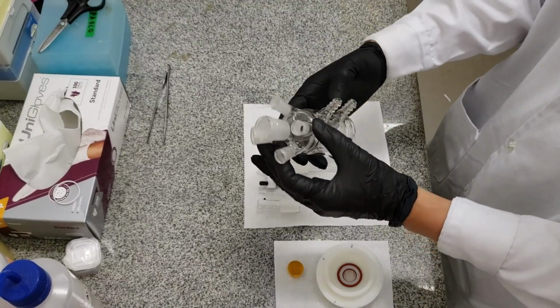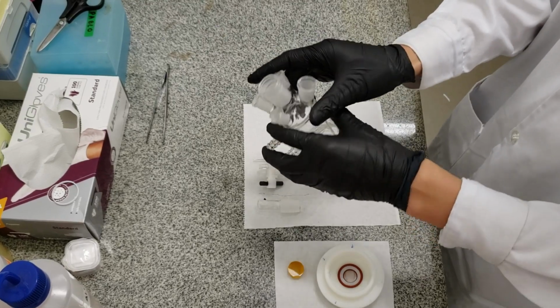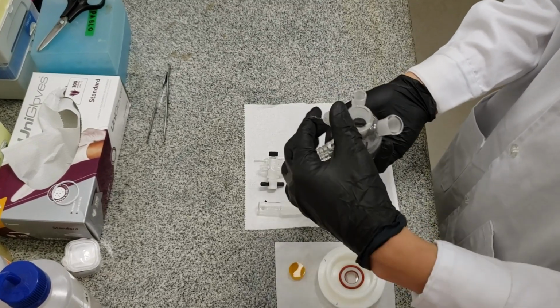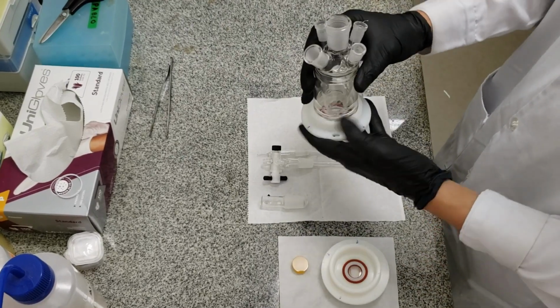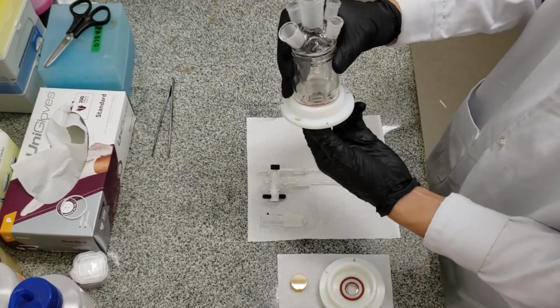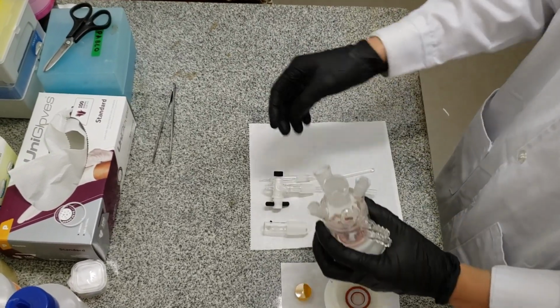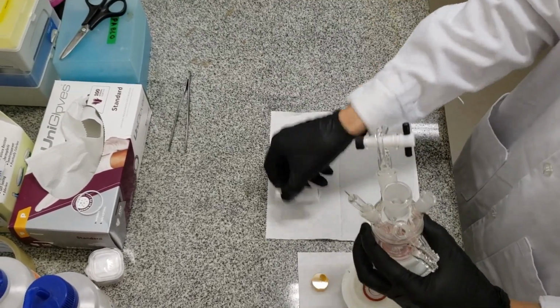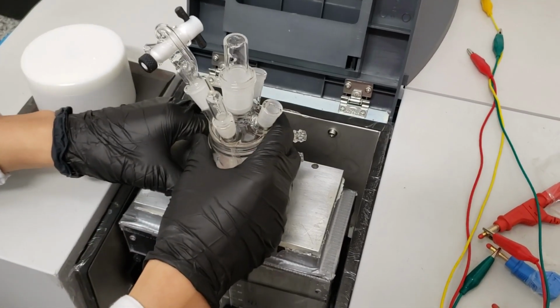Now that the holders are ready, they can then be attached to a conventional three electrodes electrochemical cell. First, we insert the counter electrode. Then we take one of the holders and screw it with the cell. This way, the cell is closed at the bottom with the window or the prism. Then we add the other components of the cell. With all this, we are ready to perform in situ measurements in electrochemistry.